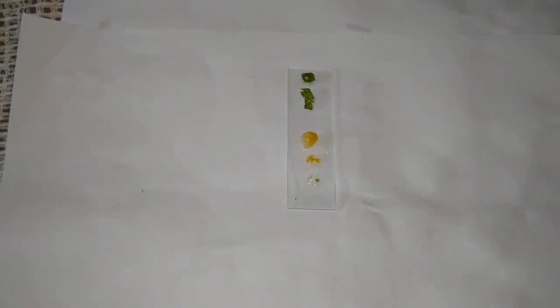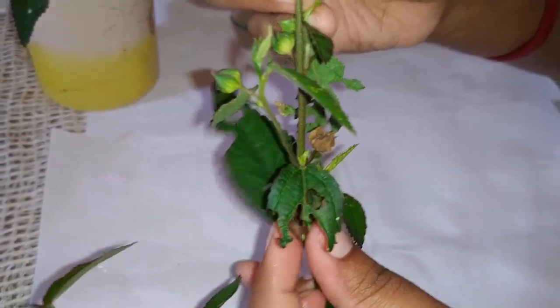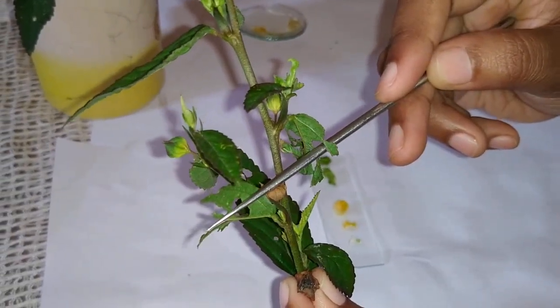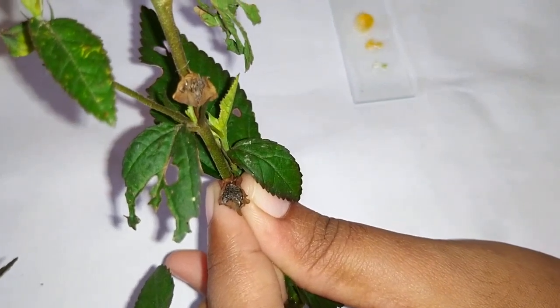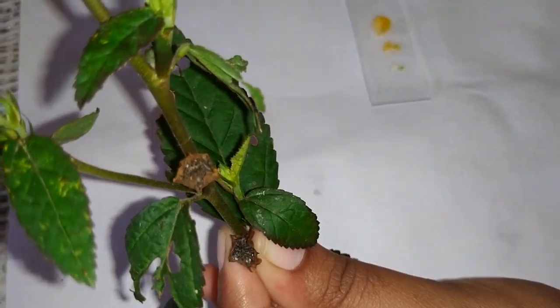The fruit type is capsule. I will show you the fruit also. That is actually the fruit of Sida.